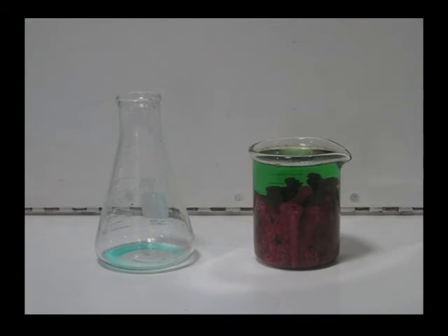I'll play my flashlight over the surface of the beaker so that you can see the color better. The iron nails are now covered with a coating of red copper.